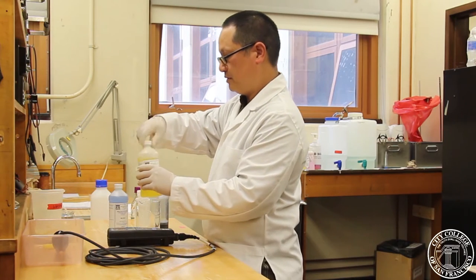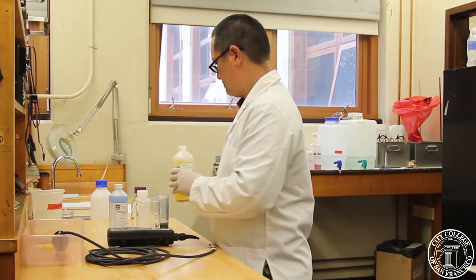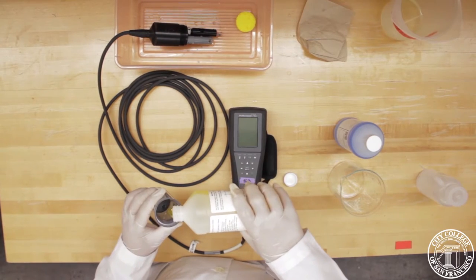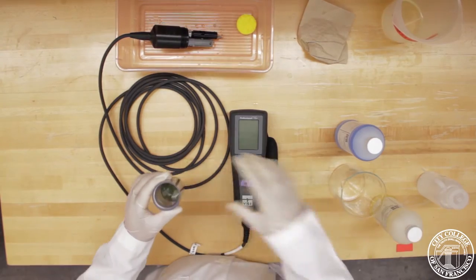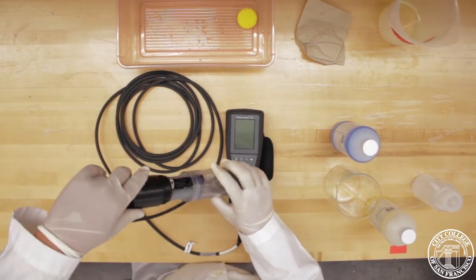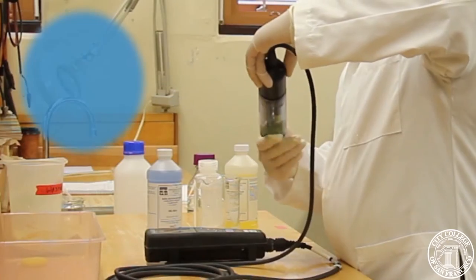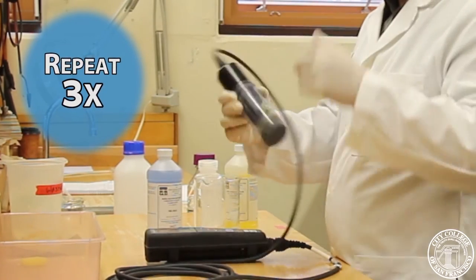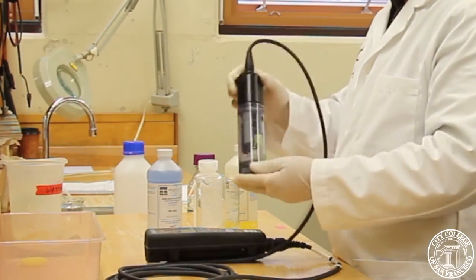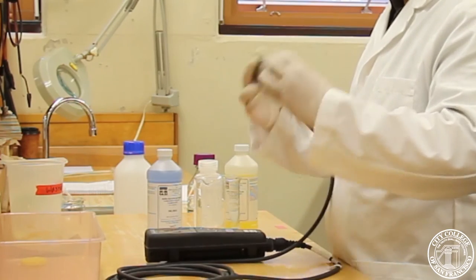So, we're going to take a little bit of pH 7, put it in the container cup, and rinse it with the probe. And ideally, you want to do this three times, trying to make sure that the bubbles are all out of the container. Otherwise, it will affect your readings.